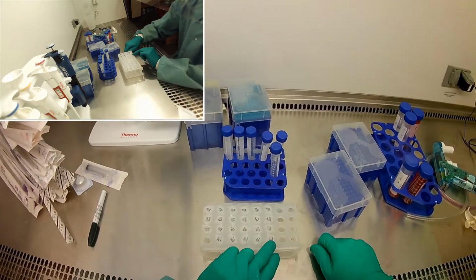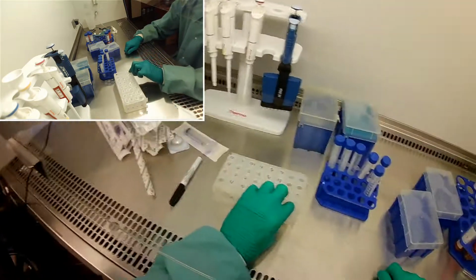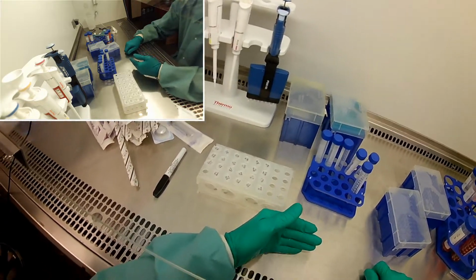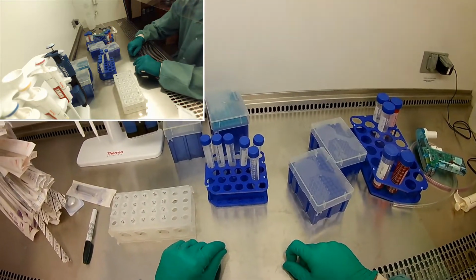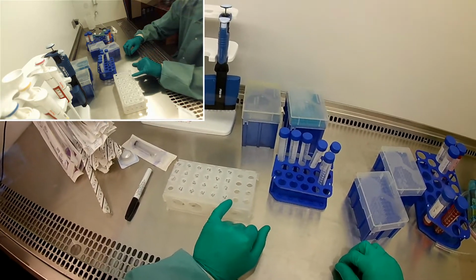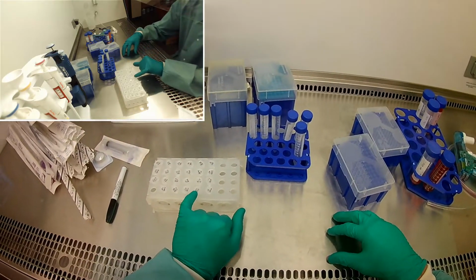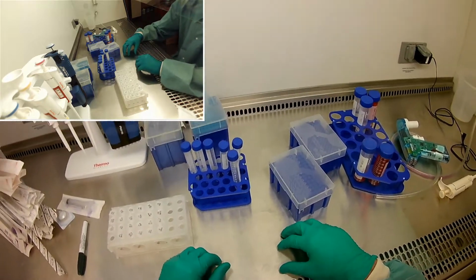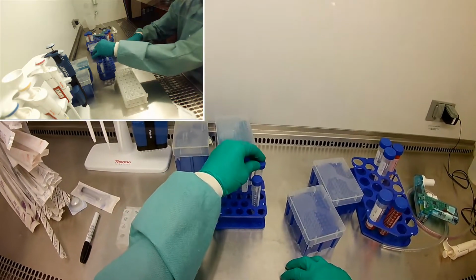And then for sugar, so our normal glucose in our DMEM media is actually high glucose. Normal glucose would be 1 gram per liter, which is 1 milligram per milliliter as well. But in our DMEM, it's 4.5 grams per liter or 4.5 milligrams per milliliter. And so what I'm going to do is just take multiples of that 4.5. So our normal control will have 4.5, and then we'll have 9, 13.5, 18, 22.5, and 27 milligrams per milliliter of glucose in there. And so I have these out to make that.